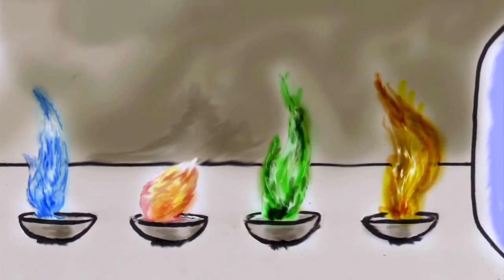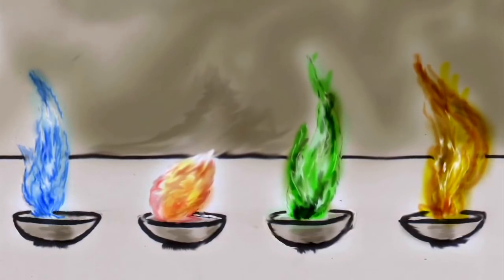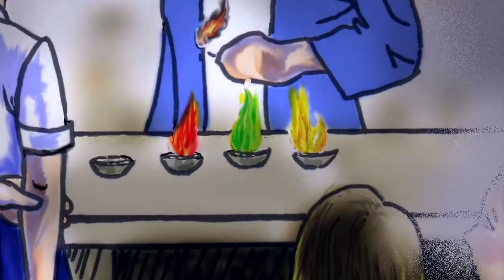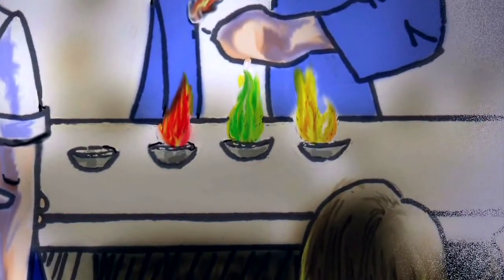It was called the Rainbow Experiment. It was meant to show how different chemicals burn at different light frequencies. So the flames end up being different colors when you burn them. And in the demonstration, she had it set up in little dishes, the chemical salts mixed with an accelerant. And none of us knew at the time what it was. It turned out to be methanol.